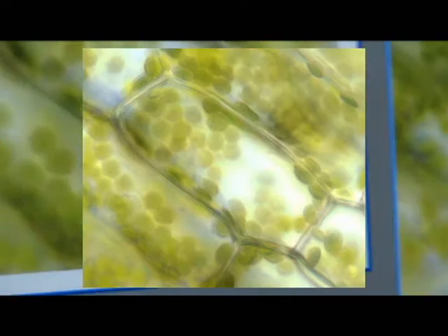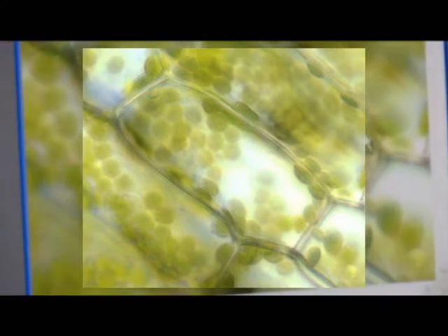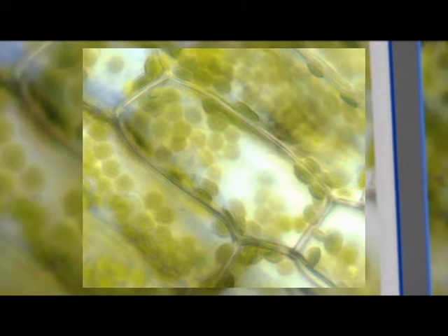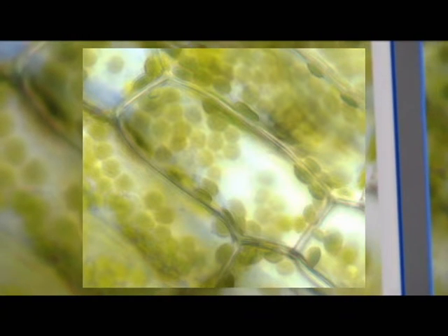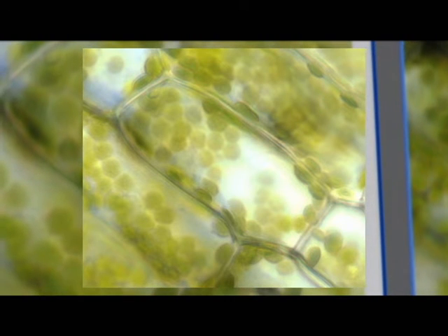I took one still image of this cell, which can be seen on this side of the monitor, and we're going to use this still image to model an Elodea cell. In your lab, students can pick one cell that they find interesting and choose to model that cell.